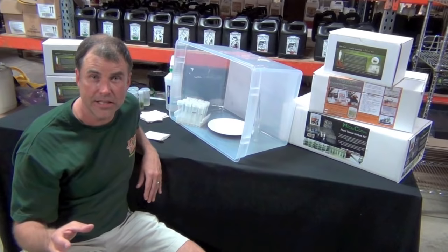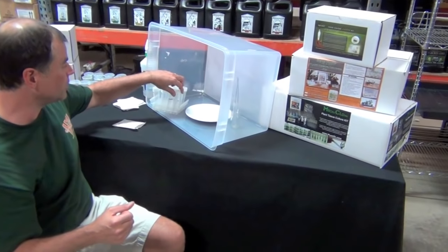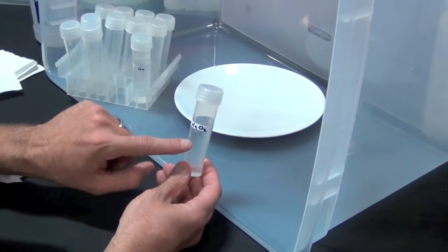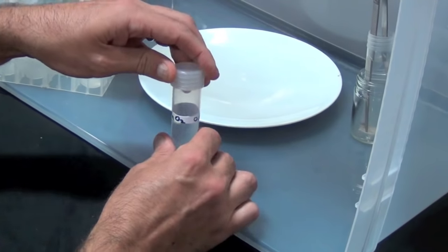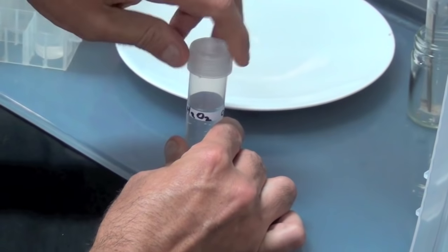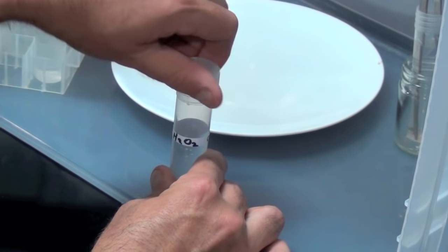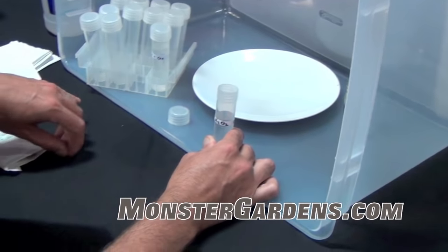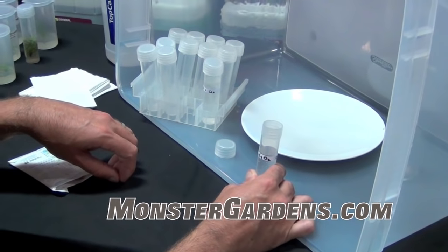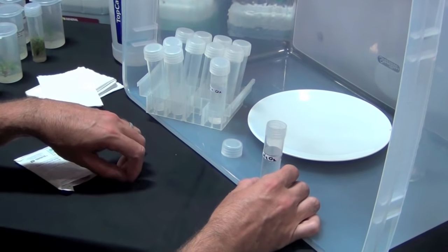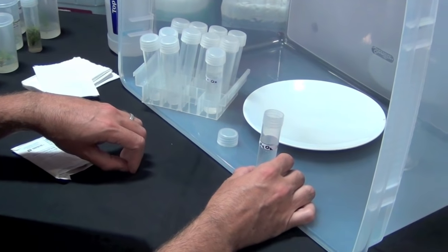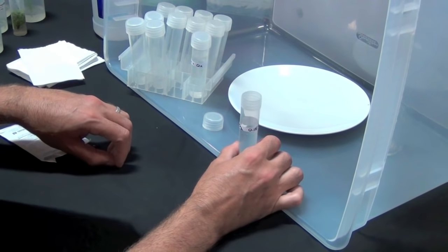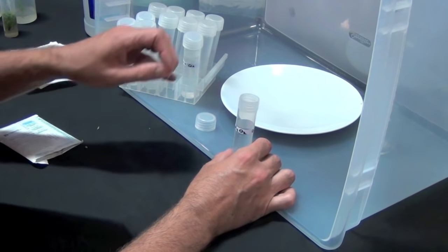Let me show you what we put together in this kit. We're going to start by surface sterilizing the seeds. I'm going to throw seeds into this bottle right here. This is a 0.15 percent solution of hydrogen peroxide. Sounds really complex, but this is just grocery store peroxide diluted 1 to 20 - about 2 milliliters of peroxide and 40 milliliters of water.